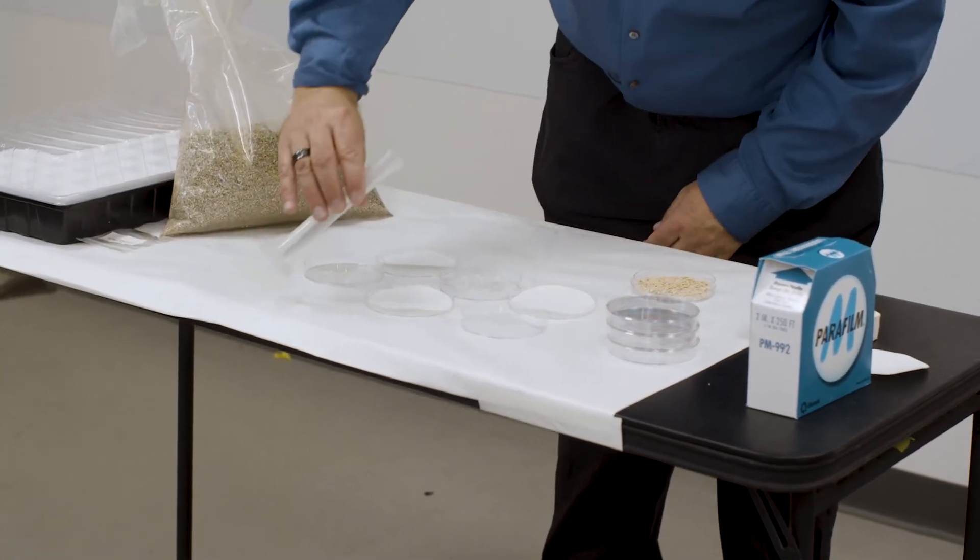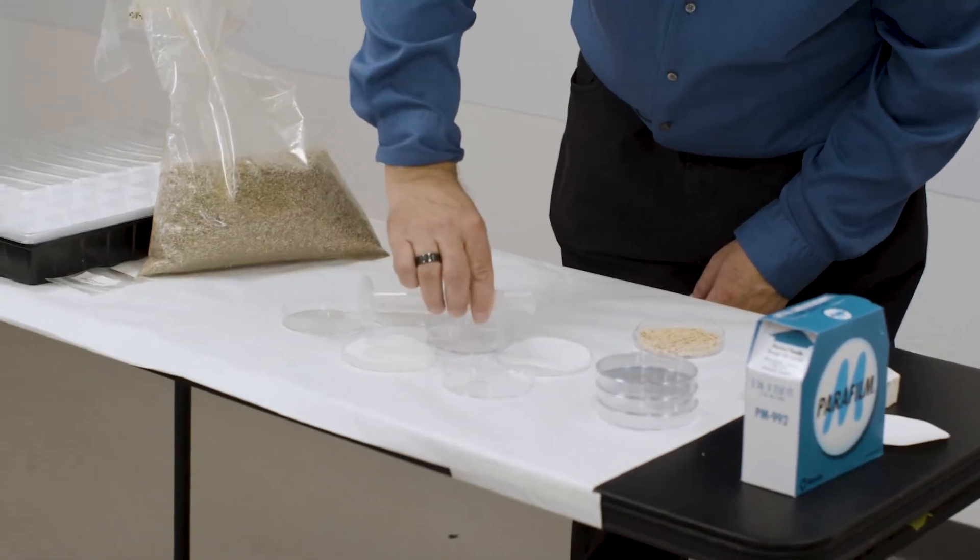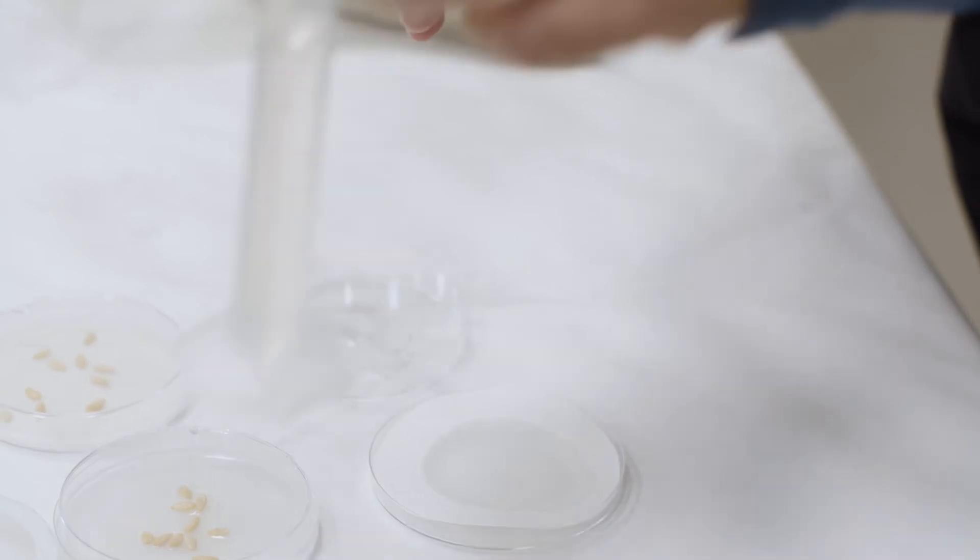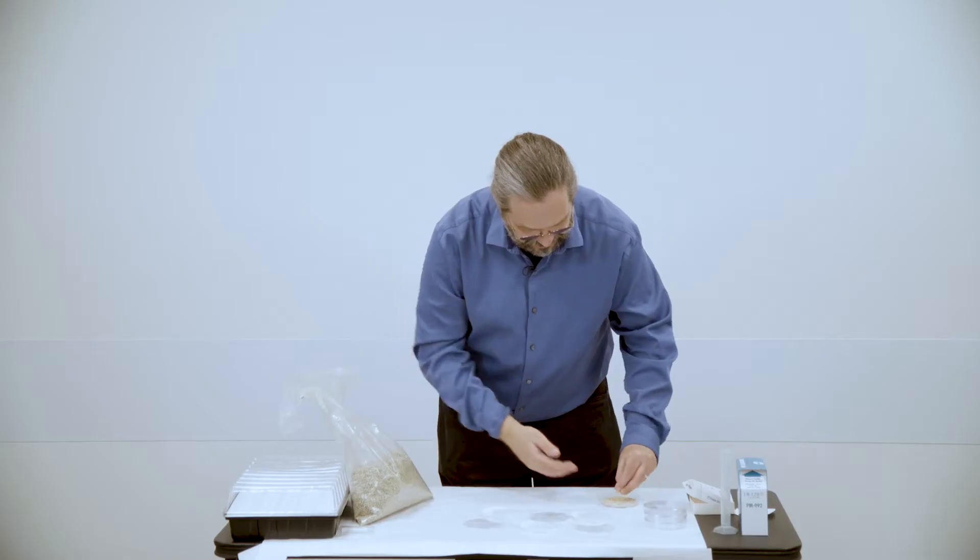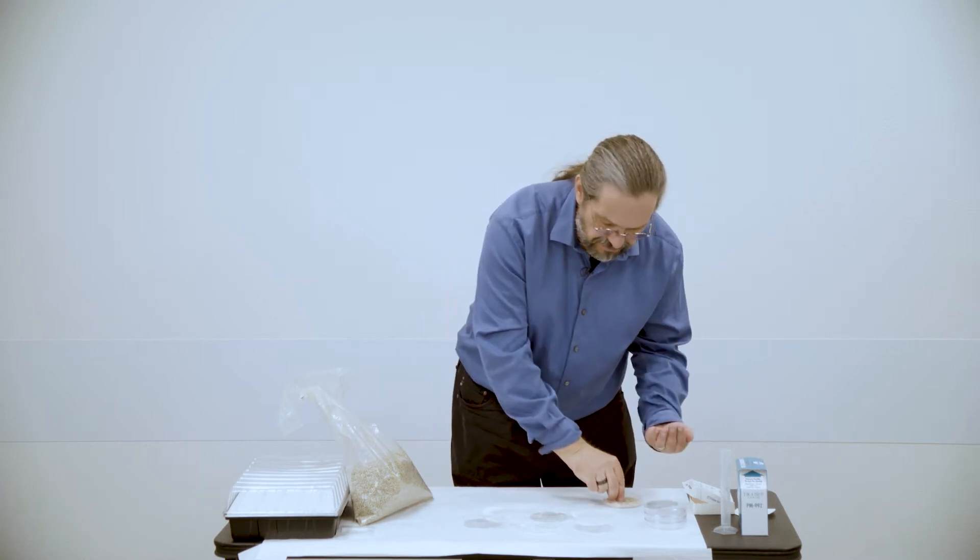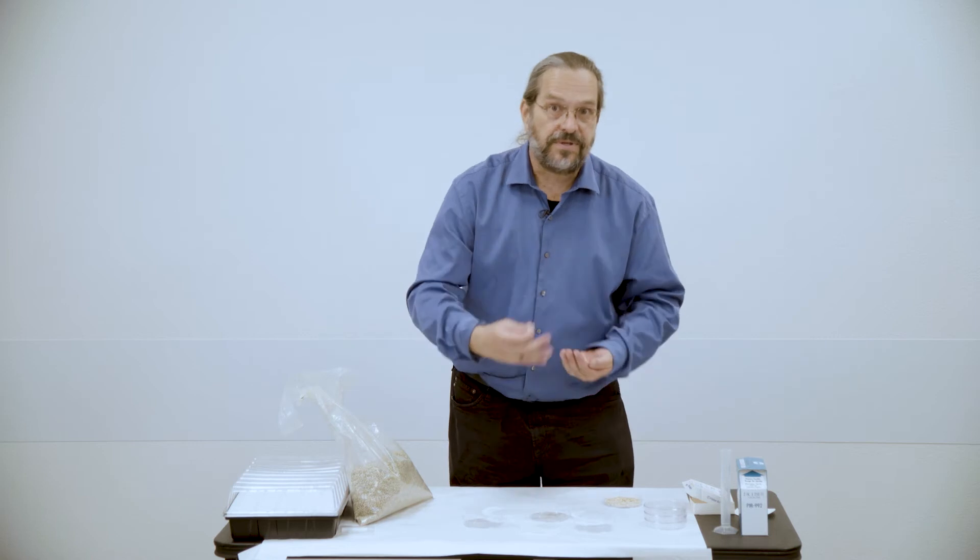We're going to add a little bit of water to each of those, just enough to get the petri dish wet. And then I actually have here some spare seeds from one of my other research projects, cucumber seeds. Not necessarily recommending them for this kind of work, but I'm not saying they're bad. This is again, something that is great to explore with your students.